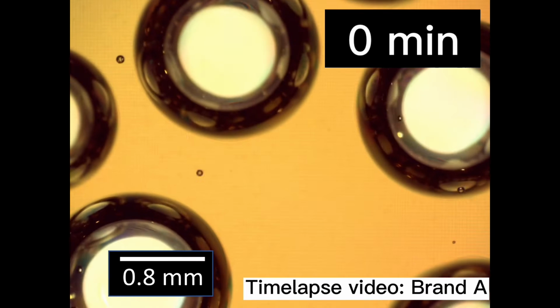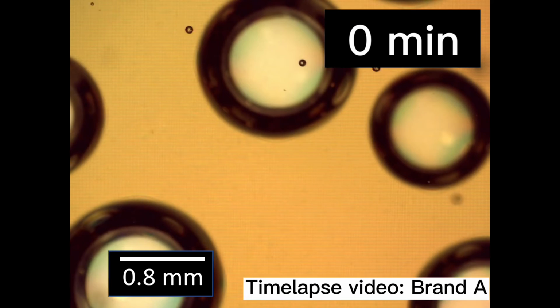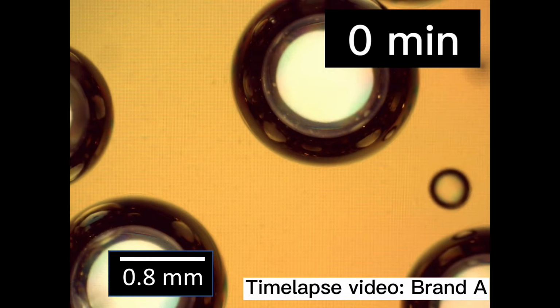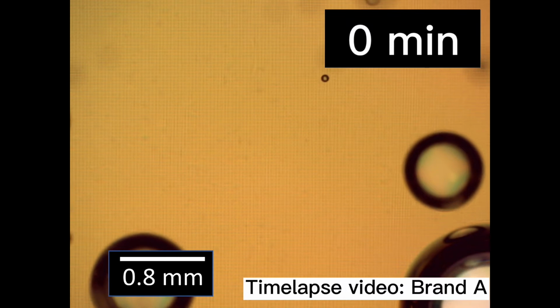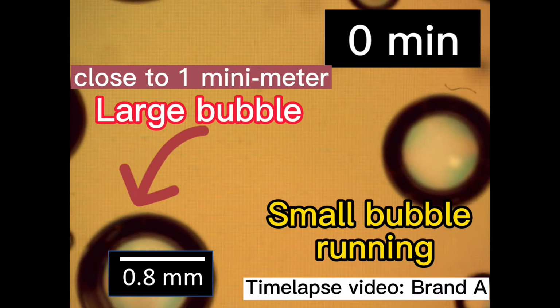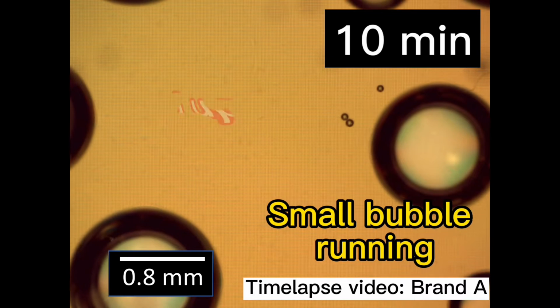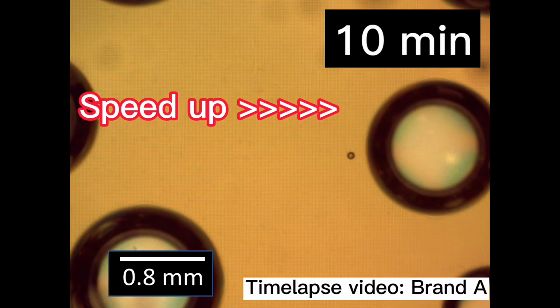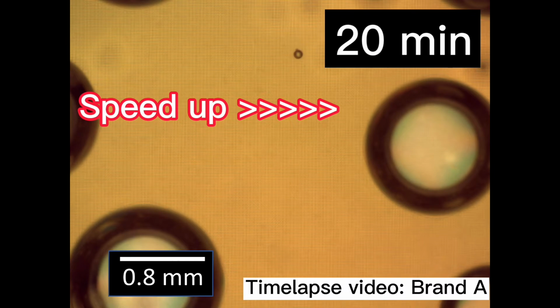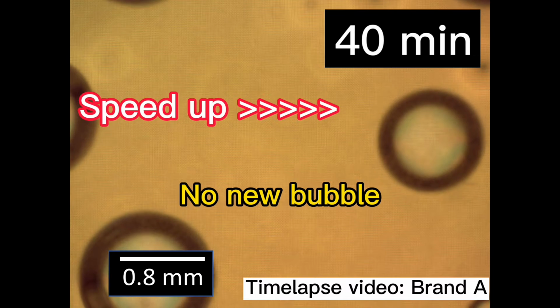Let's take a look at the time-lapse microscope image of Coke, which is known as a world-class brand. In the first 10 minutes, I saw a lot of small bubbles running around in it, less than 100 micrometers, and some large bubbles close to 1 millimeter kept appearing and disappearing. Next, we accelerated the video 5 times, and we can find that the bubbles are not moving obviously, which means that the gas volume of Coke will be greatly reduced after 10 minutes.